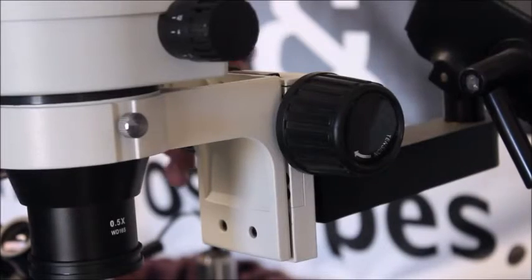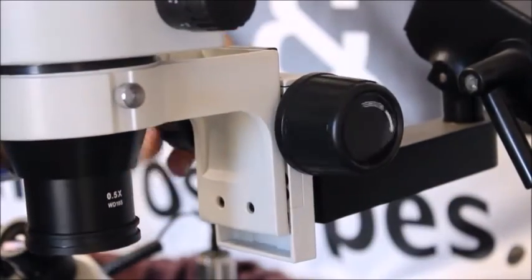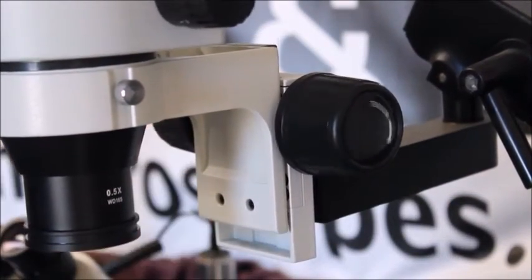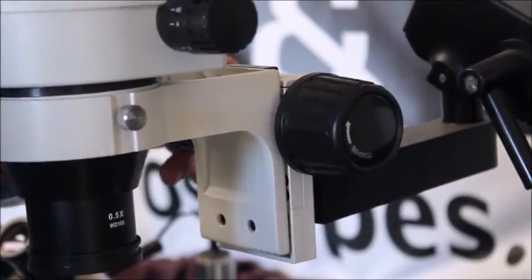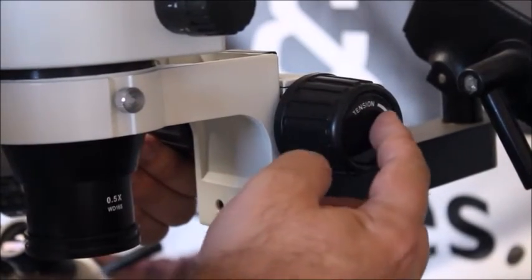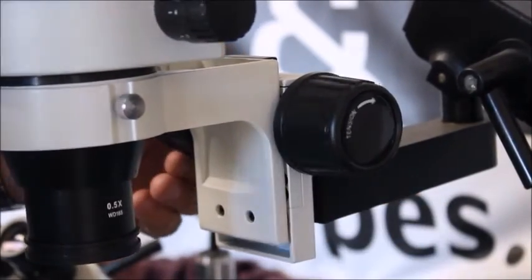This is a different kind of stereo microscope and it's got a different mount as well and you can see it's falling. And this one even says right there tension and it always has an arrow pointing towards being tightened.